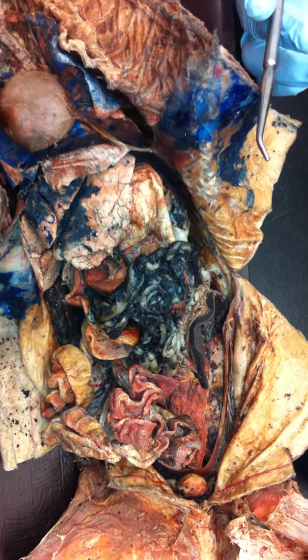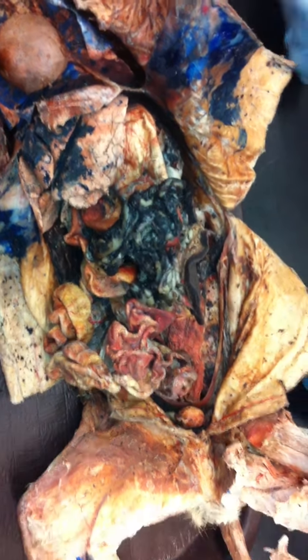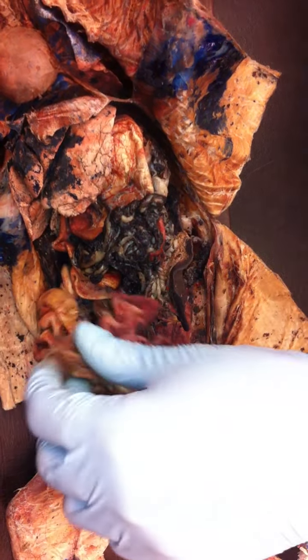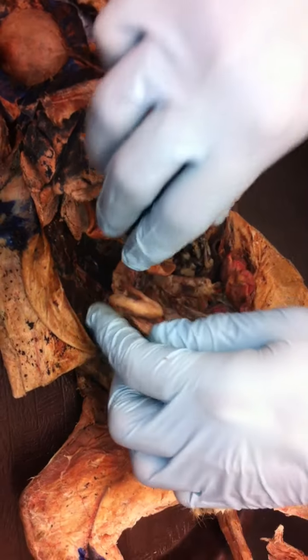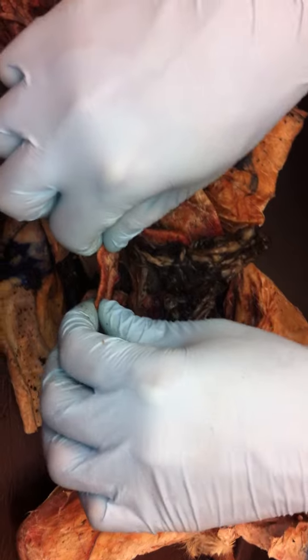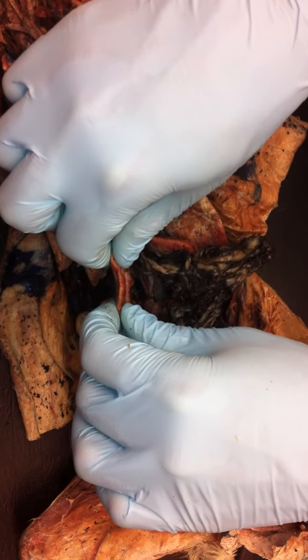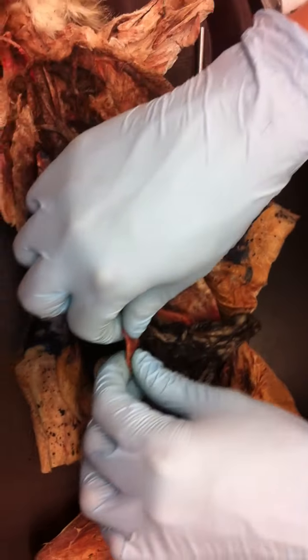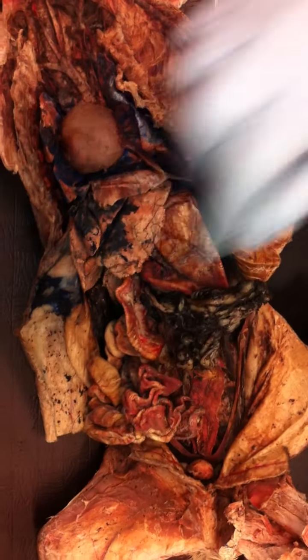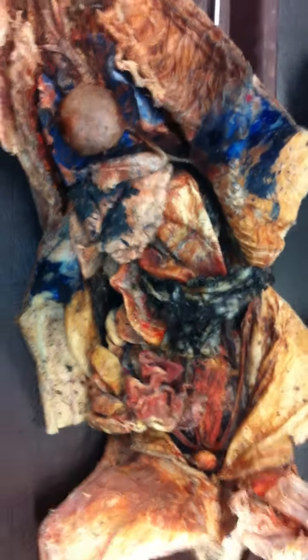Okay? Sounds good. But you guys, small intestines are easy. Right. Duodenum is a little difficult, but the only thing you need to tell the difference between is if you find the stomach, right at it's the first part. Okay? So if I pin this, it's going to be within an inch of the stomach. Okay? Yeah. That's it. Okay.